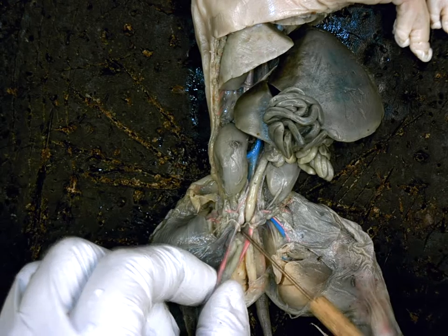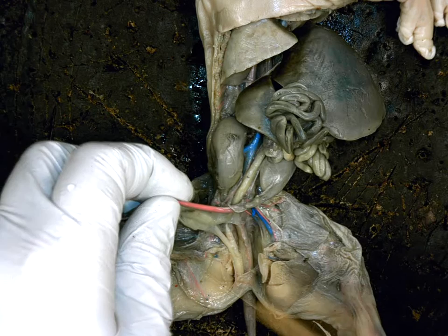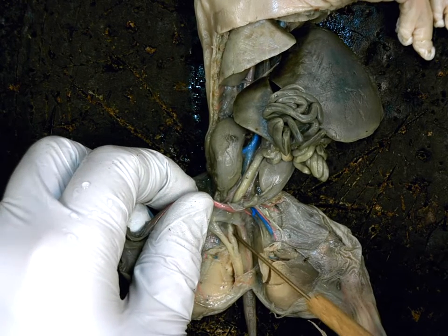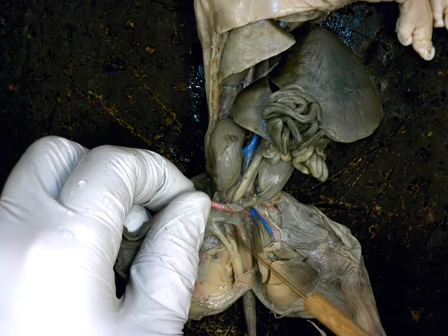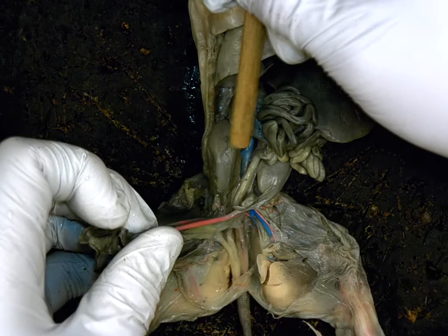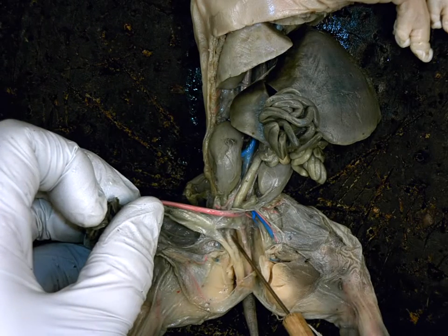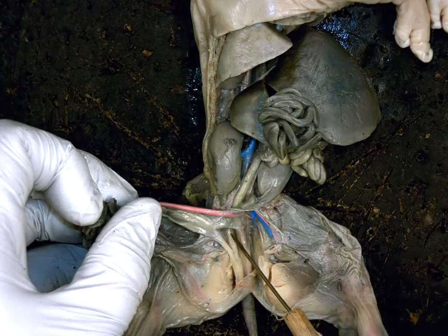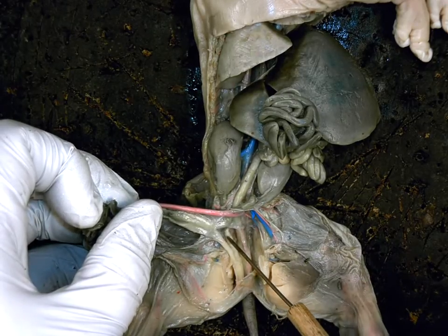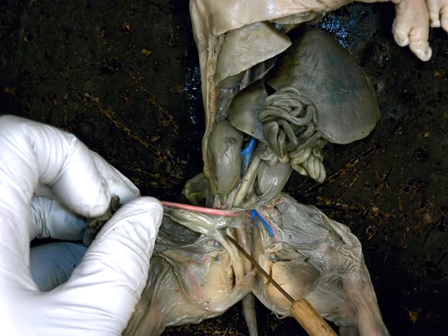Okay, so if I go down underneath this, if I just pick up on my bladder, I should see directly underneath it is this white tube. This is the uterus, which dove underneath the bladder. Again, I can kind of put my probe under here to follow it. The uterine horns come down and turn into this tube right here, which is the uterus. What's the function of the uterus? To store what for development? Store the fetus for development, okay?